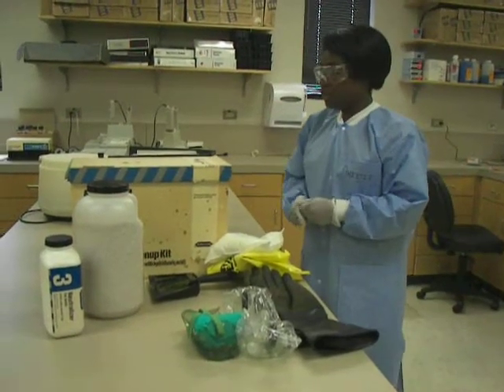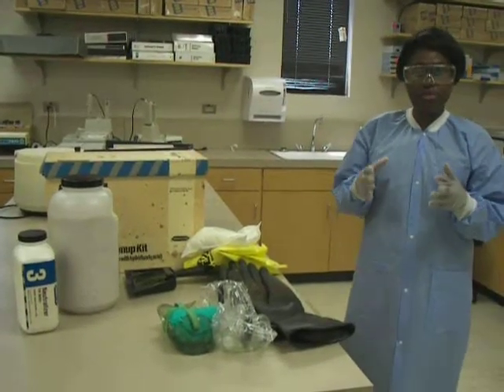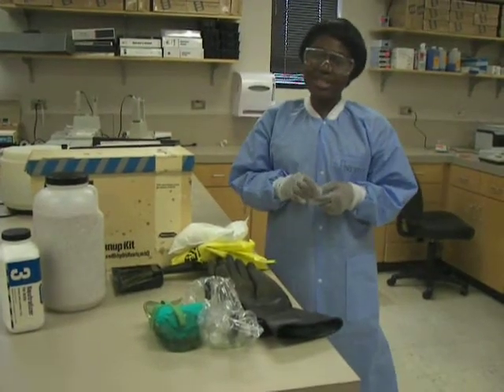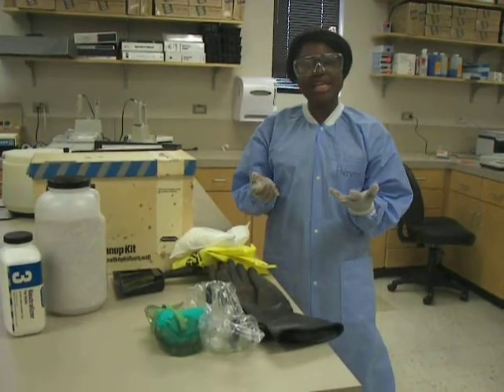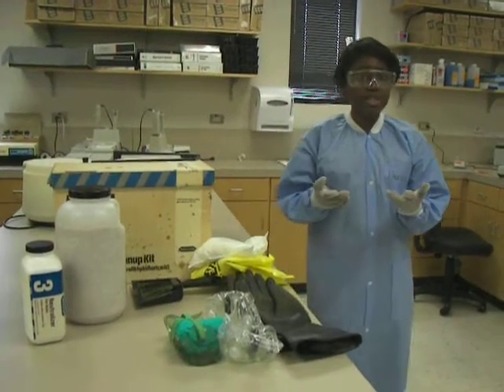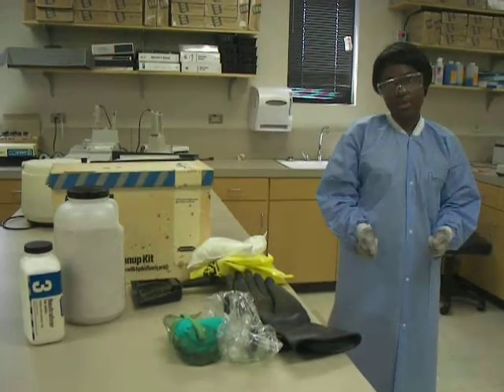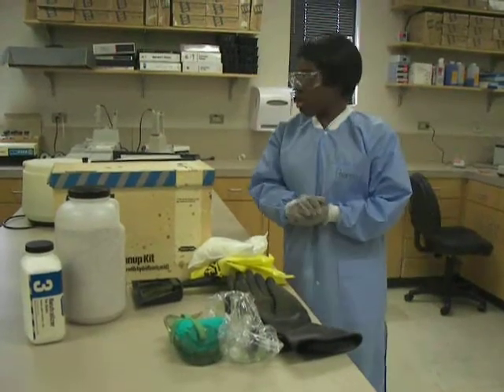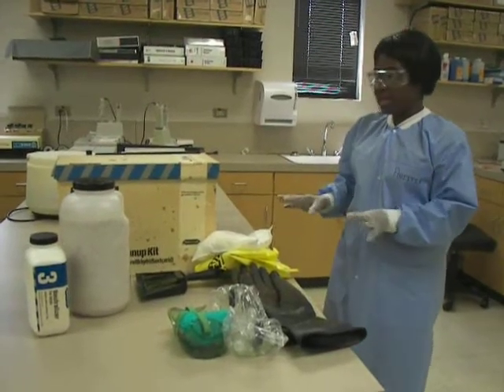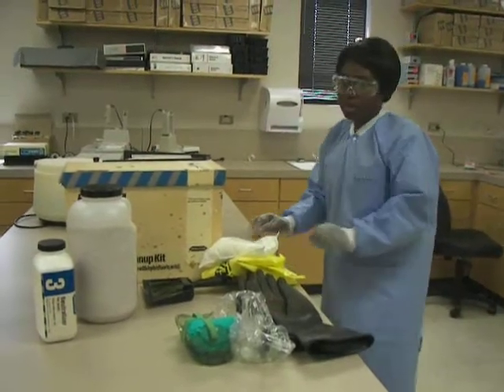When that is done, you also have to have the right frame of mind. One thing you don't want to do is take medication that can interfere with your thought process, because such medication can slow down your ability to respond quickly to any chemical spill. You also have to make sure that the area you are working in is free from all clutter.